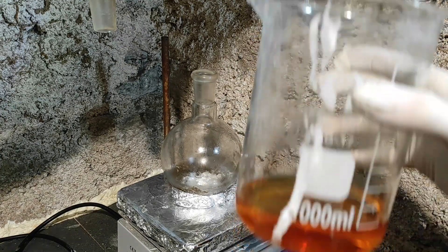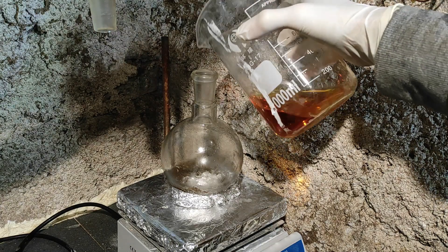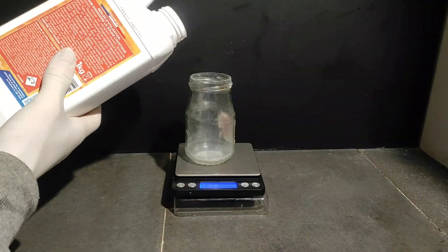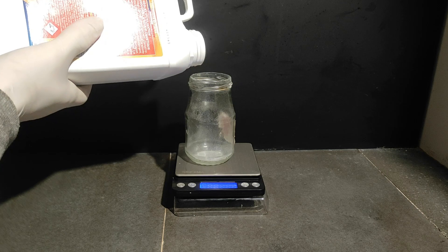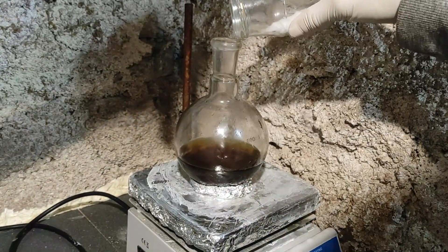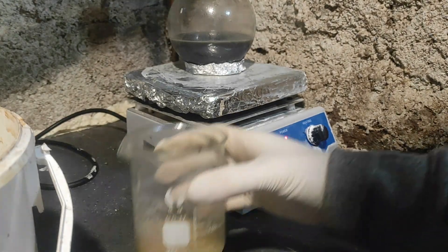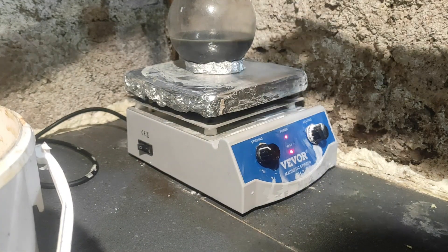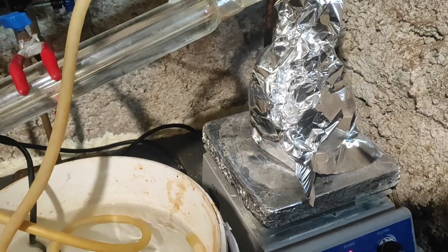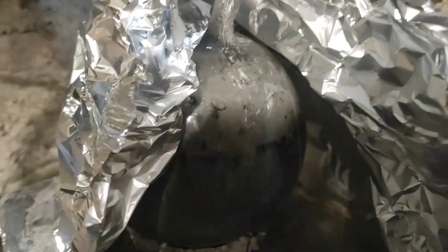For the third step, I put a 500 ml round flask on the hotplate and added approximately 200 ml of ethylene glycol, which I obtained by boiling down some car coolant. Our second reagent is 40 g of solid sodium hydroxide, which I measured on the scale. After adding the stirrer and turning on the stirring, we add the sodium hydroxide and start to heat. After some time the solution turned greyish — not sure why — but the sodium hydroxide seems to have dissolved. So we can add our 1,2-dichloroethylbenzene and close the apparatus with a condenser to distill the product. The phenylacetylene should distill after being produced at approximately 143 degrees Celsius, but I collected a bit more to be sure to get everything.